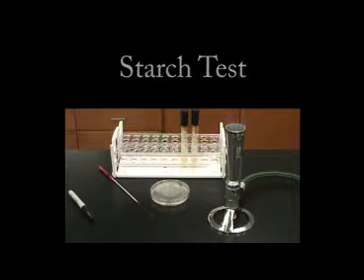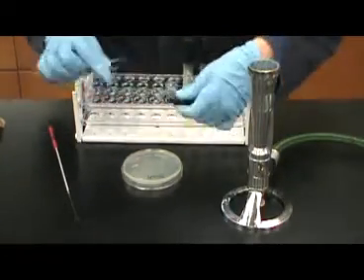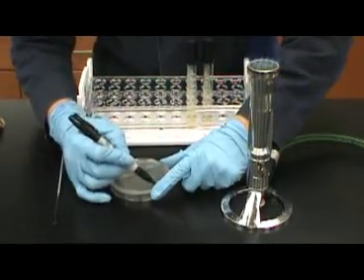The Starch Test, testing for the hydrolysis of starch. To begin the starch test, you will need an agar plate supplemented with starch, the bacteria with which you are going to inoculate it, and a Bunsen burner and loop.